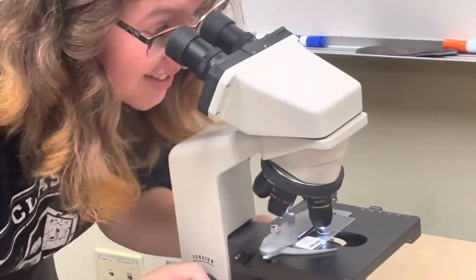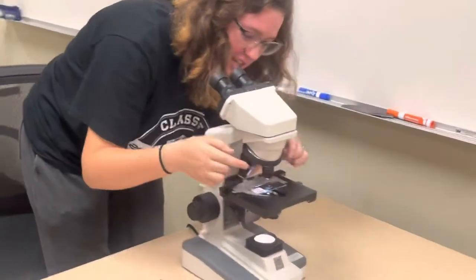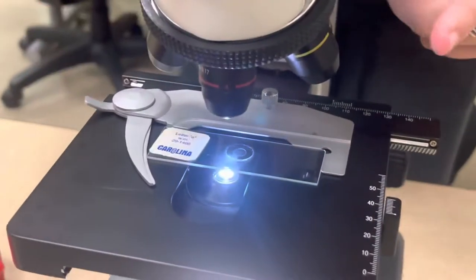Make sure it's sitting flat. What I usually do is I will adjust it kind of by eye. And then I'll go ahead and zoom in with this. So make sure that when you start it, it's on red. You're going from red to yellow, so four times to ten times.